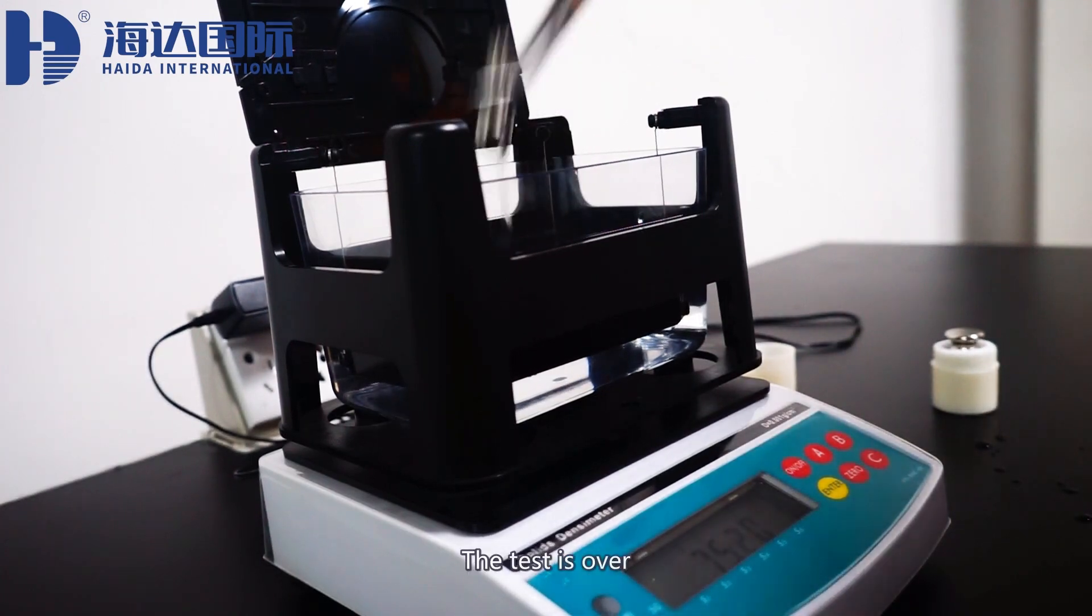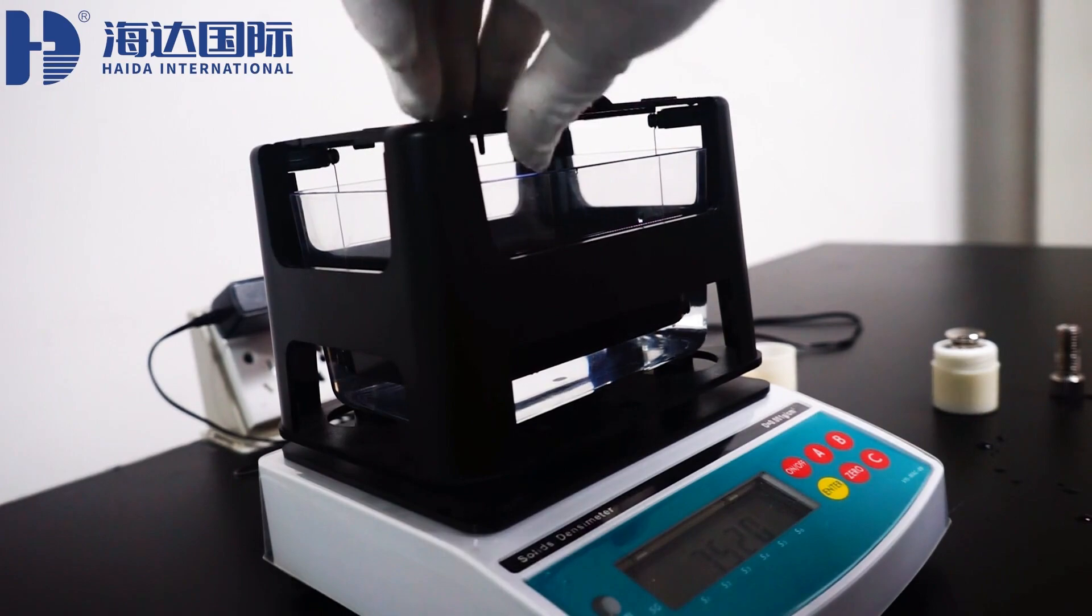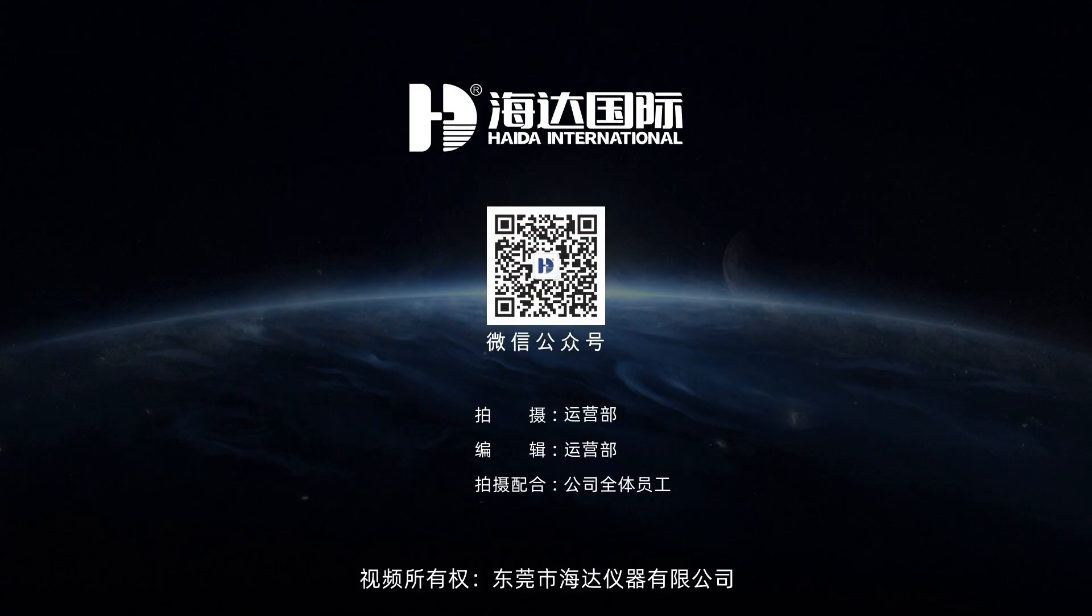Sample density in real time. The test is over. Take out the screws and power off.